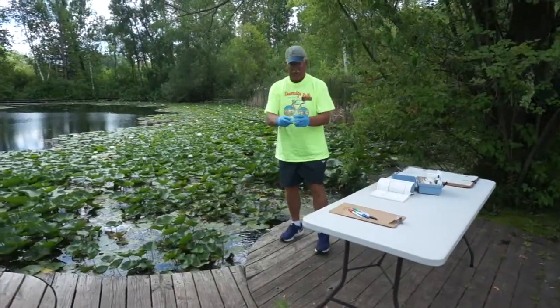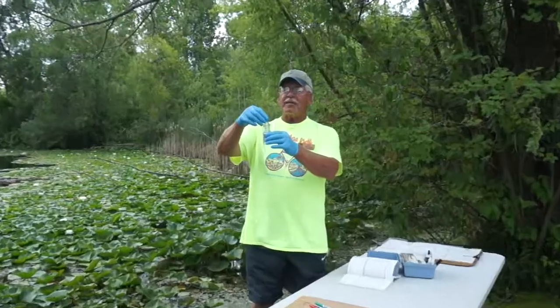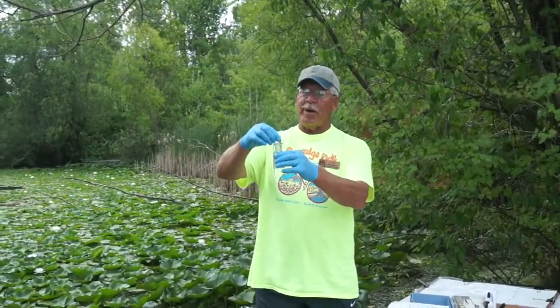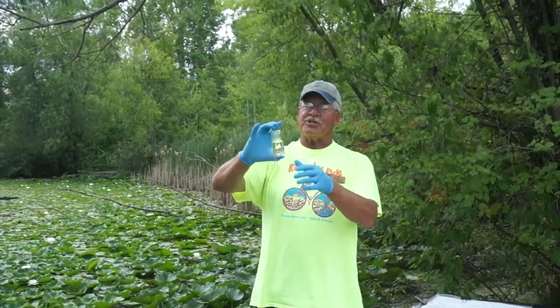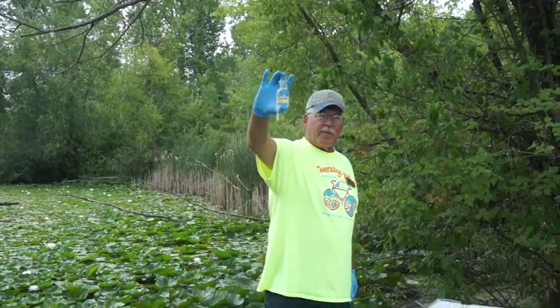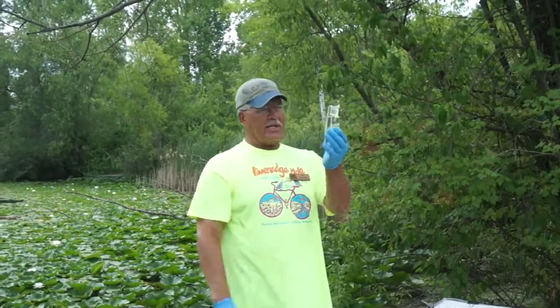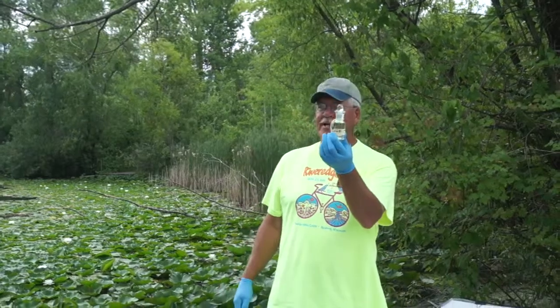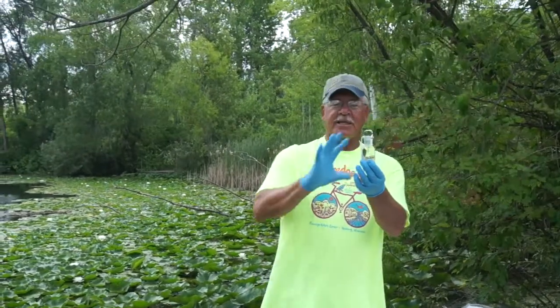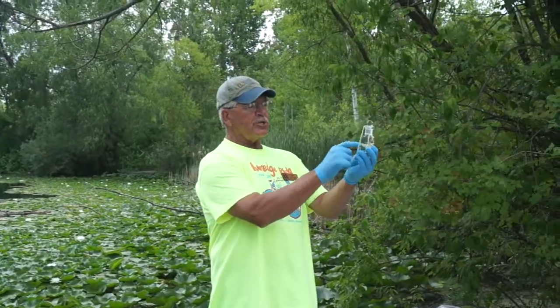like so, then what I do is I gently put a stopper on top so that there's no air bubbles. Again, I don't want air bubbles because if I've got air bubbles in there, then I'll be measuring the air that we have in the oxygen here, and I don't want that. So there's my sample. That water, undoubtedly from the pond, has organics in it. It doesn't look like it. It's perfectly clear, but you surely would not take a drink of that because there's all kinds of things that could be in there.